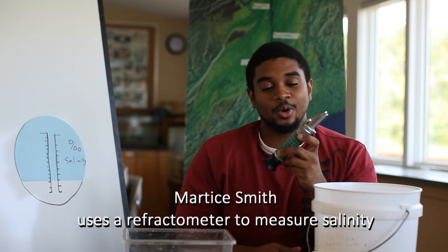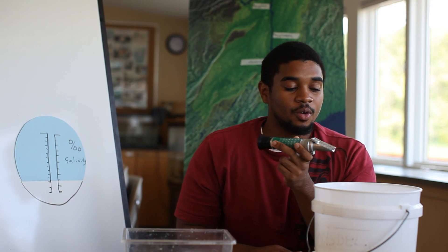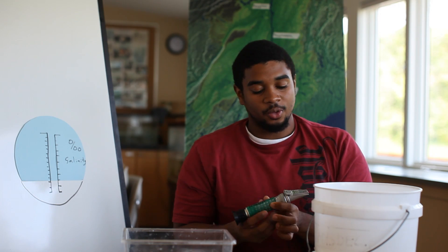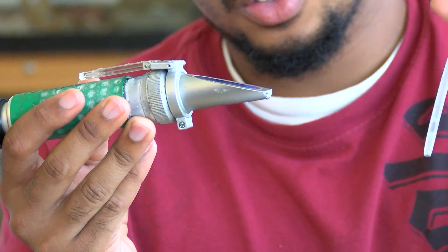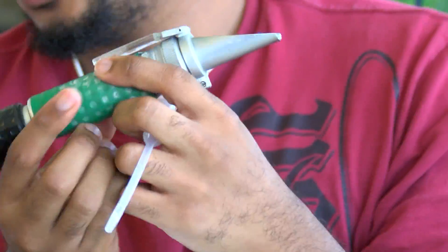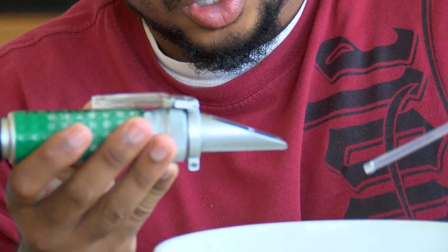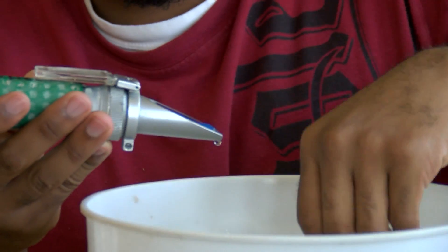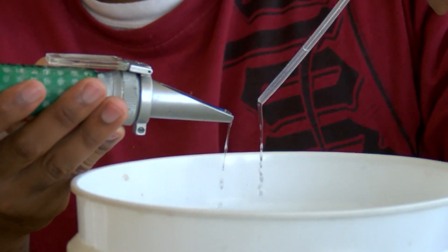Let's go measure some salt. This device is called a refractometer, used to measure salinity for different waters. We're going to be using it today to measure brackish water. How this works is light refracts through a thin layer of the water and gives us a value on these scales — we'll be focusing on the salinity one. You want to rinse it off first with the water you are going to be testing, to make sure any dirt or dried salt is rinsed off and won't contaminate your sample.